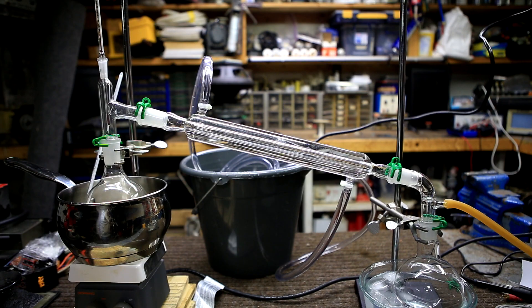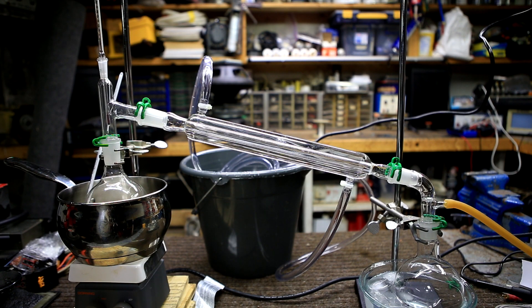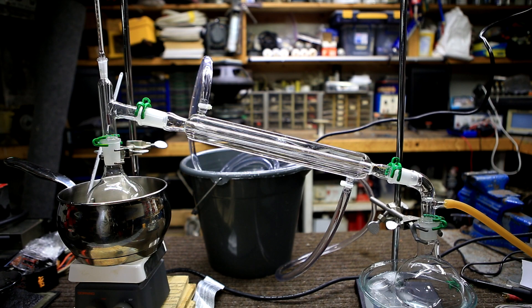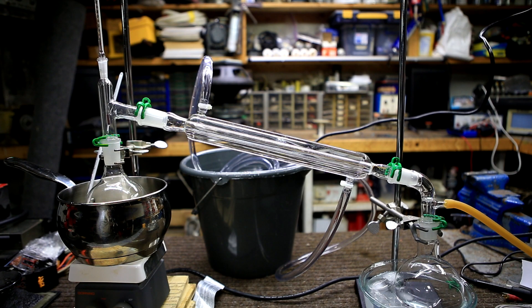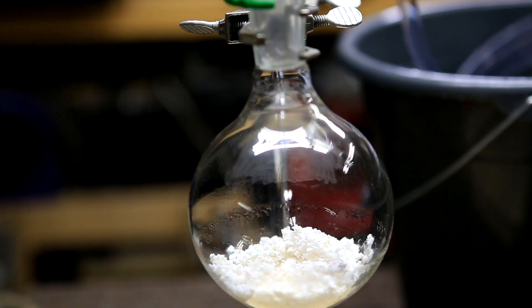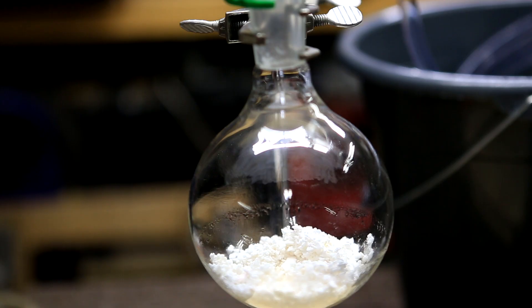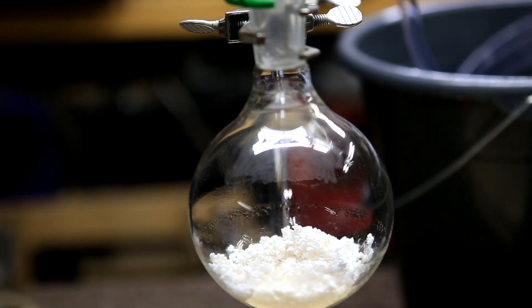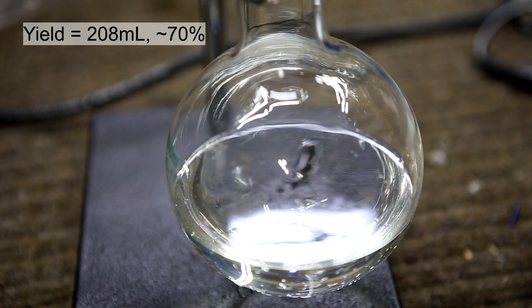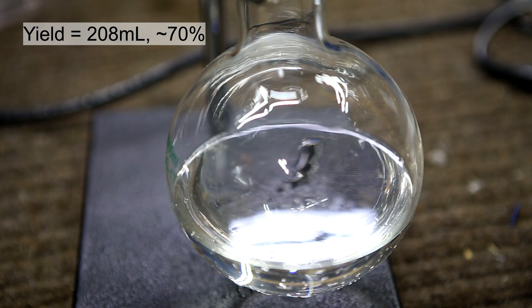Then I reset up a distillation and redistilled the ether using a water bath. This time, a simple distillation is enough. I kept the water bath temperature low at around 40 to 50 degrees Celsius. The distillation was carried out until there was no more ether in the distillation flask. In the collecting flask, I was left with a final yield of 208 ml of diethyl ether, which represents a yield of about 70%.